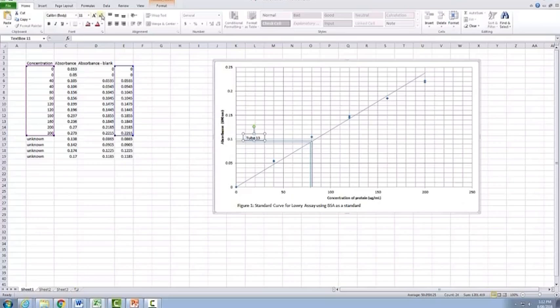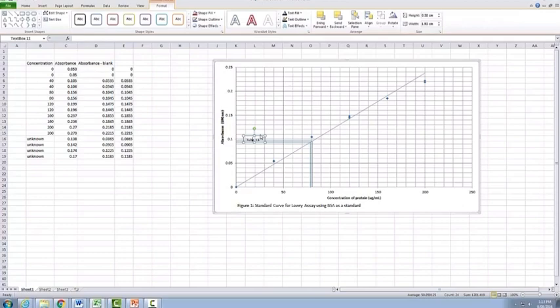You can also shrink the size of the text if you'd like, and make sure that it's sitting in the actual position that you would like. So you can always move this text box to a position that sits better on top of the line. So you can add in a text box for each of your different unknowns that are on here. So this is the basics of how to draw your graph.